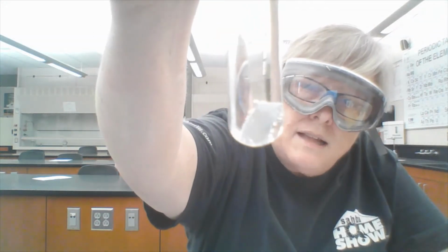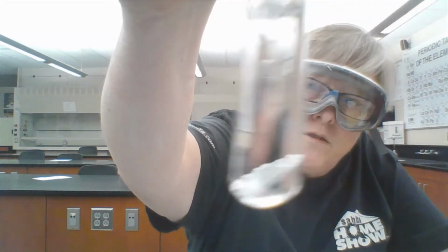So then we have sulfuric acid and the copper strip. And there's not a thing going on in there. The copper strip is just sitting at the bottom. No bubbles, no nothing. So tube number 5, I would say nothing is happening. And then tube number 6, sulfuric acid and the zinc is producing lots of bubbles. The bubbles are even rising to the top. You can see there's bubbles on that strip of zinc.